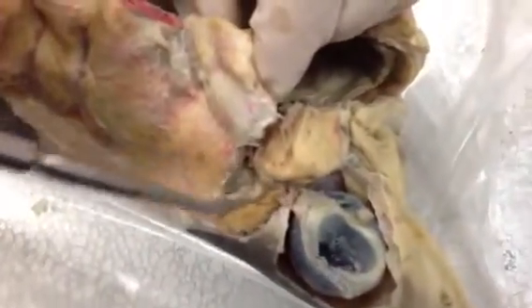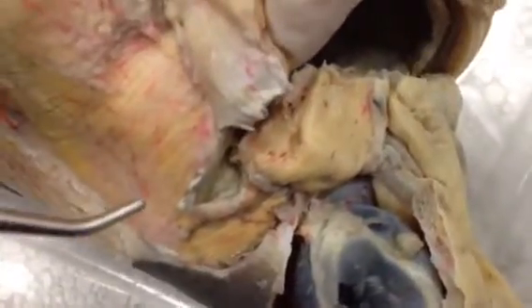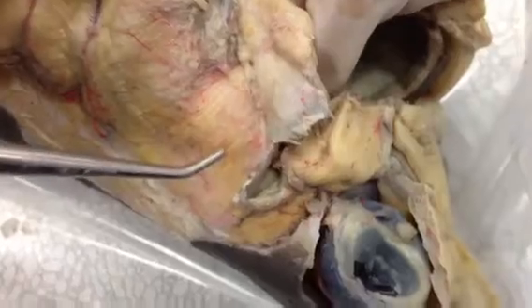You'll need to know that the spiracle — which is hard to see online — where the spiracle is, it has a pseudobranch gill with lamellae, and that's because it only has one on one side, but that's also more definitional. It also has a spiracular valve, which is just the valve that controls it.